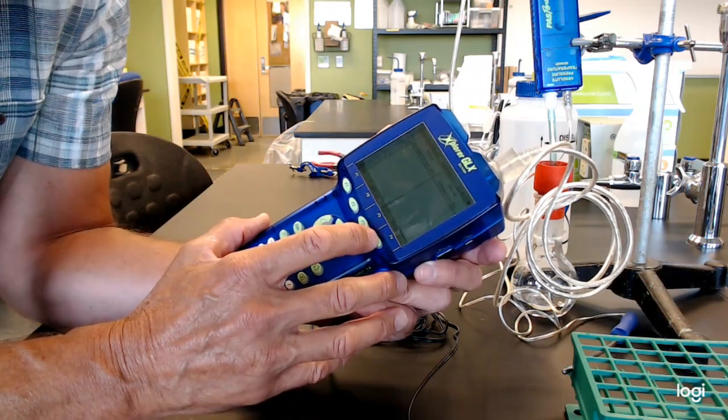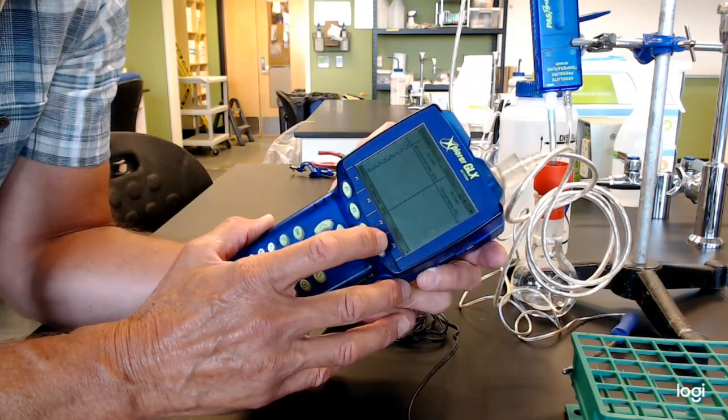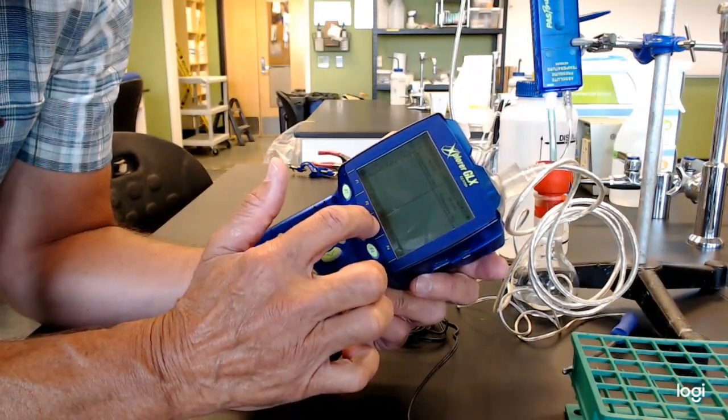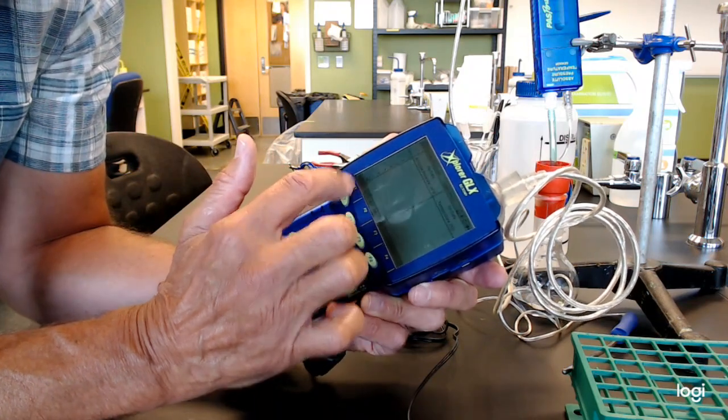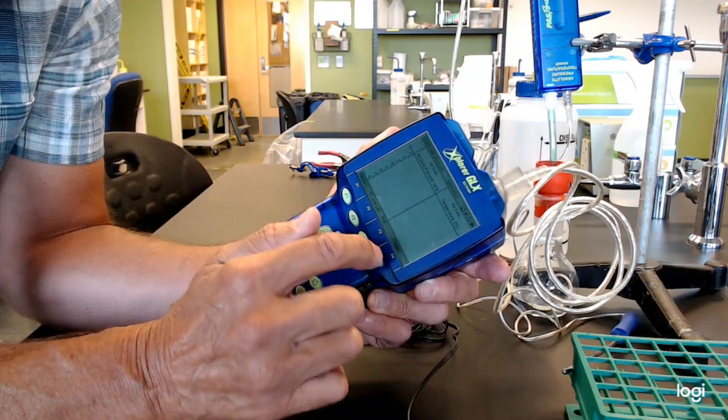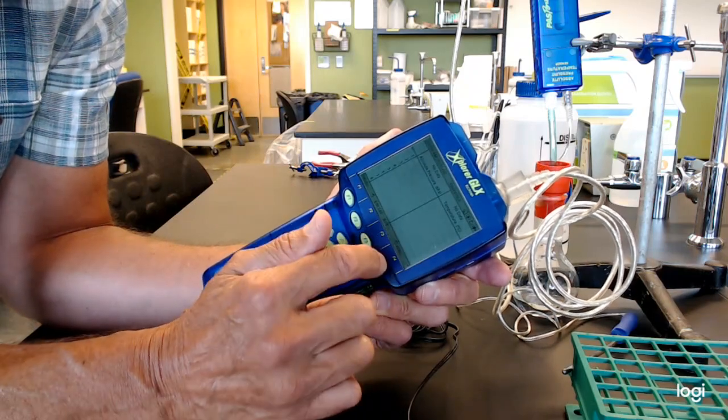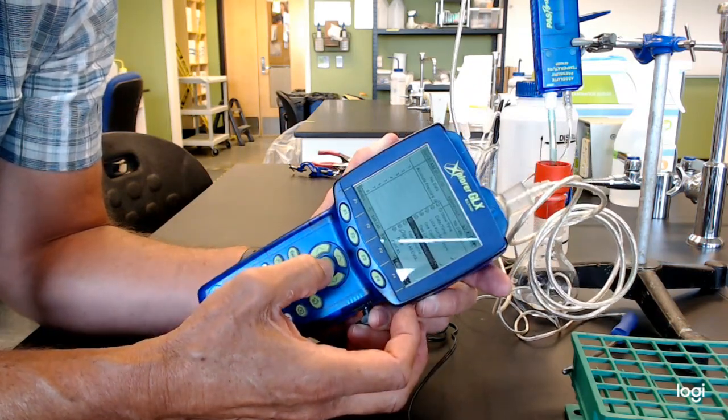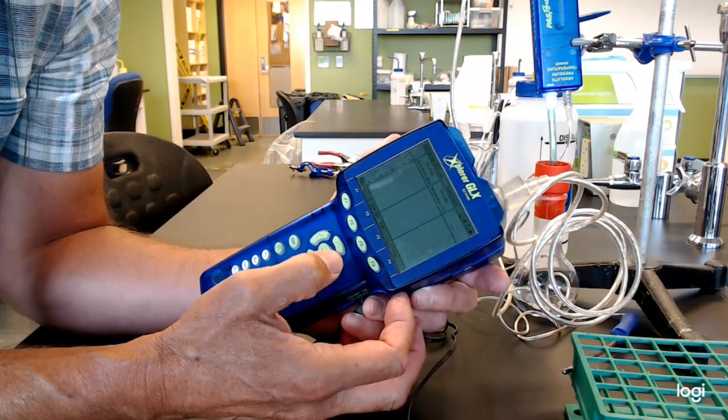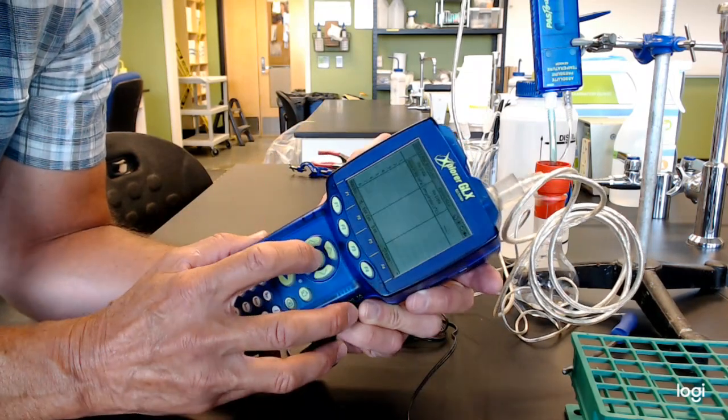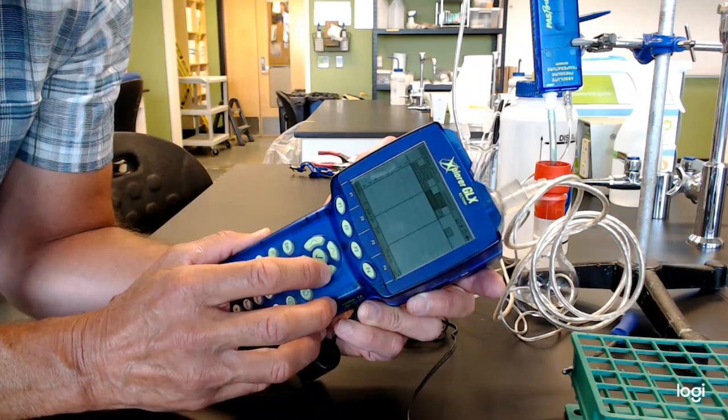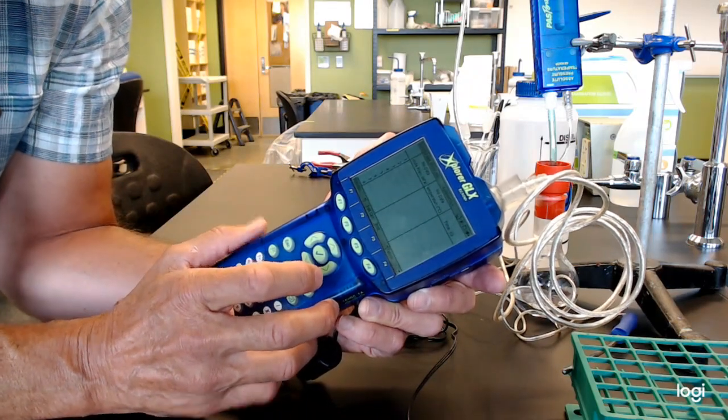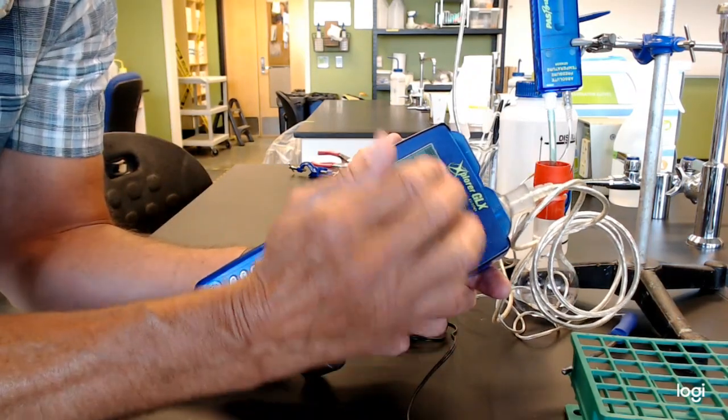We have temperature and pressure. If you needed another column, for example, if you wanted to also put time in there, you can go down here. Any commands along the bottom, I have an option of tables, edit, edit cell, and statistics. If it says it's right above the F4, I push the F4, and that gives me the option. So if I wanted to put a third column in, which I'll just do for a grin so you can see it, I could also say, and it's blank right now. So I'm going to run over to that column and say, oh, what the heck, why don't we just put time in there?